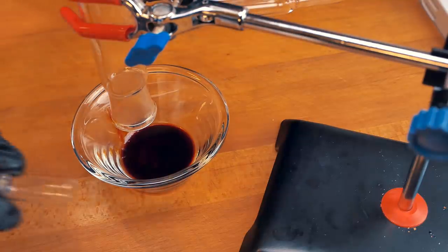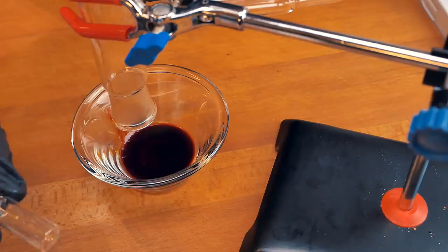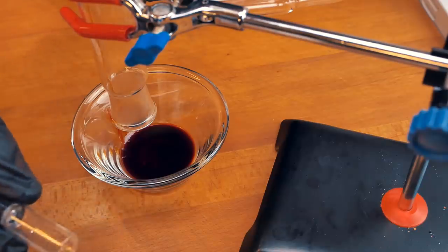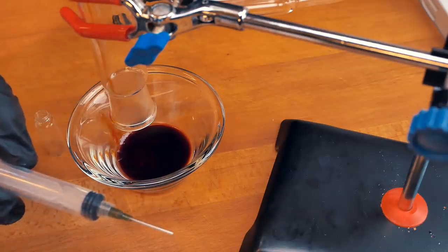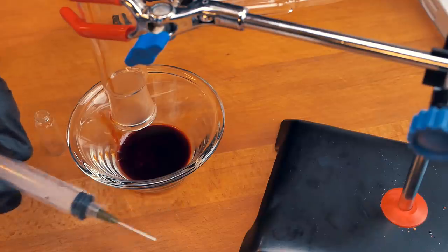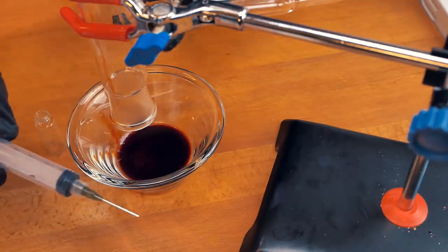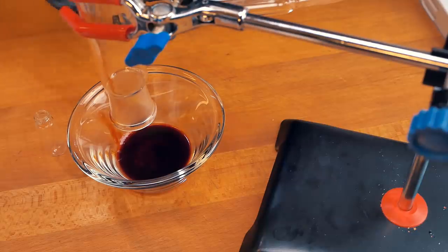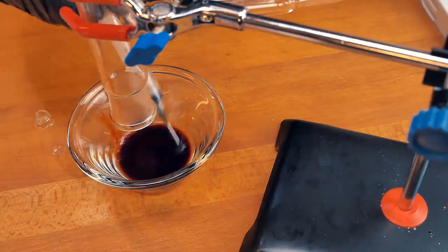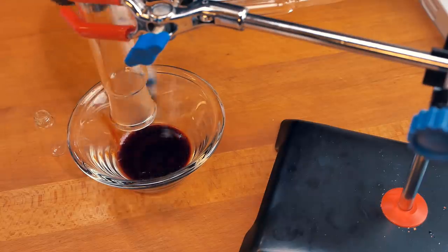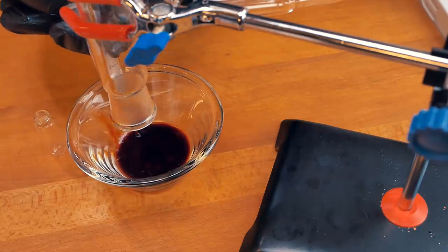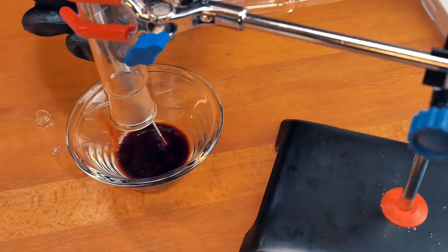What I'm going to use to bottle this are these little vials. And again, I'll put a link down below. You can see where I put them. I learned my lesson the last time I did this. I didn't have a syringe and it made this very difficult. I was using a pipette, and it just took forever because it's so gloopy. This stuff is like syrup. So I thought a syringe is going to be a much better option.